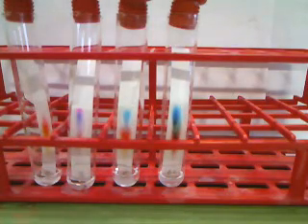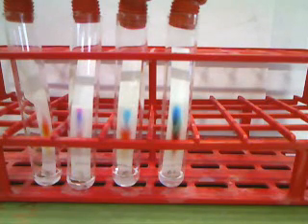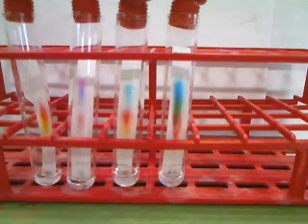Again, it's been several minutes, and as you can see, the solvent is moving up and the dots are moving up as well. So things are going along. Finally, the solvent has gotten up near the top of the filter paper, and so now it is time to again take the strips out, mark where the solvent got to, and figure out how far each of our dots moved on the filter paper.